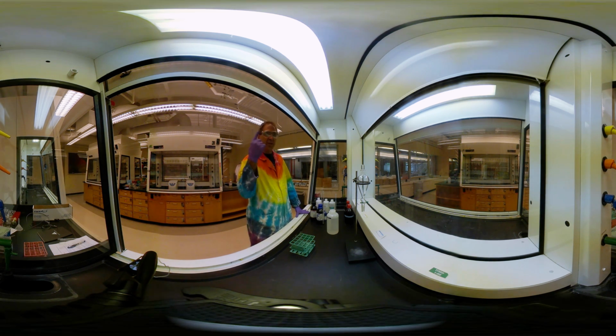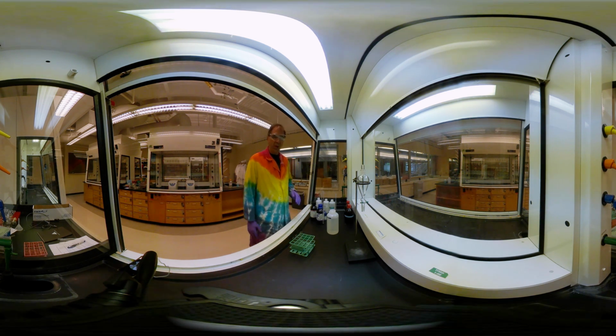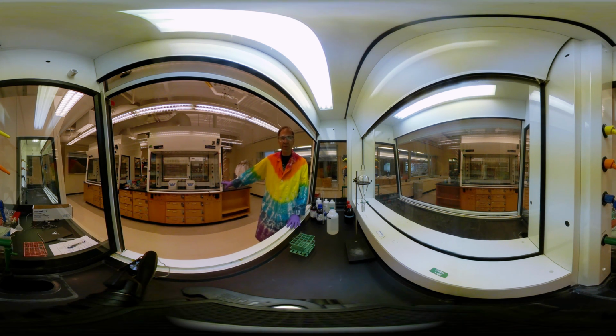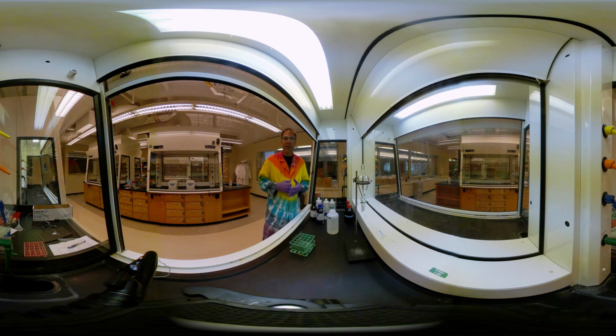And go ahead and just kind of spin the video around and look around the room a little bit. You can see the hoods have multiple services. We've got air, vacuum, and water. There are drawers that contain equipment, shared equipment just like normal. And then around the room itself, there's several specialized pieces of equipment, including an infrared spectrophotometer in the back. We have balances, of course, and other things. And we'll get to many of those throughout the semester as we go.